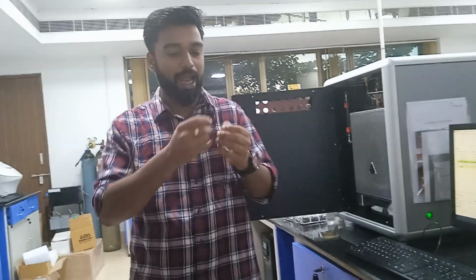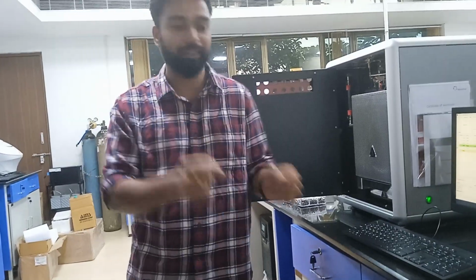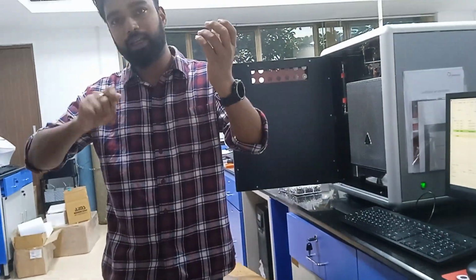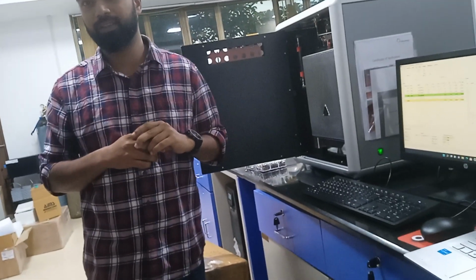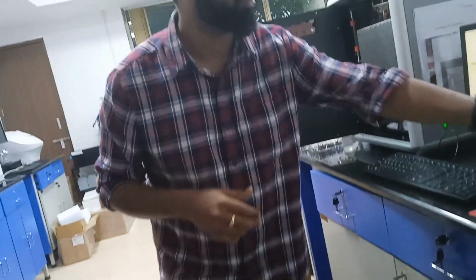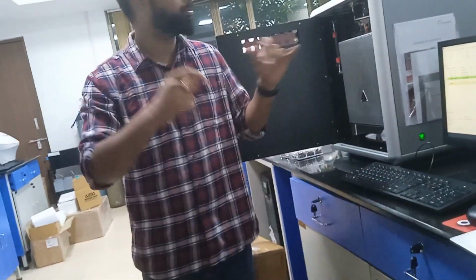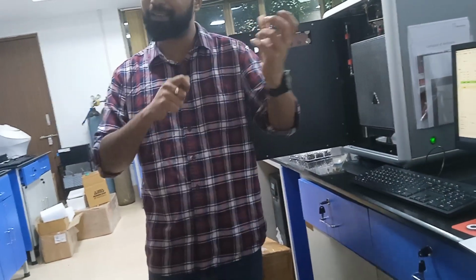In other companies they will take a pipe, and at the end they will make a saw kind of thing, a deep saw shape, and insert it like this. It is sort of a long spatula, but the head is like a seesaw, so that it comes out easily. If you are touching the surface edge of the glass and putting too much pressure, the glass might break.